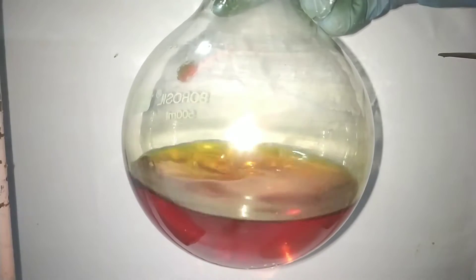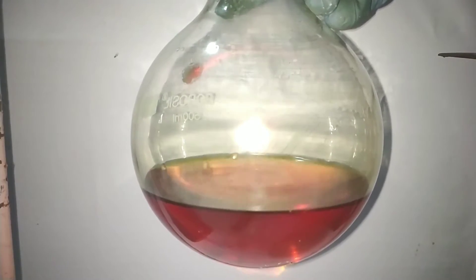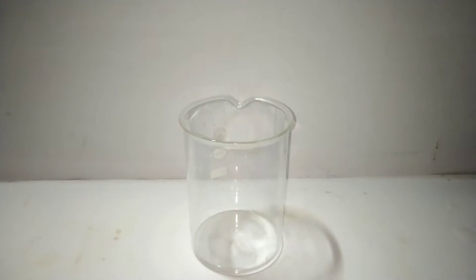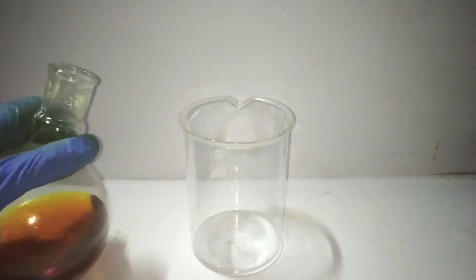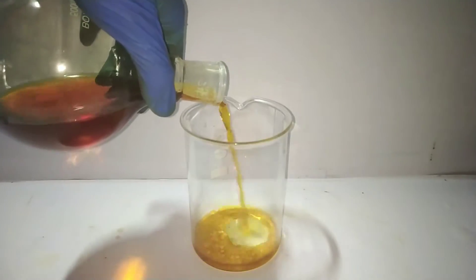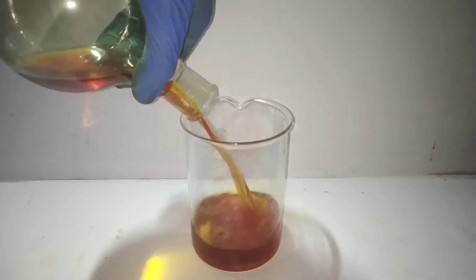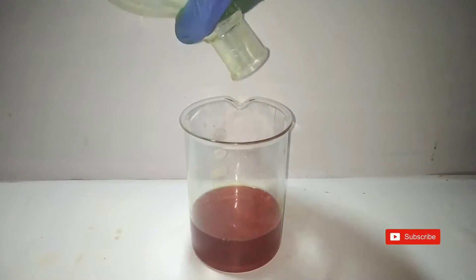The next step is to precipitate out the paranitroaniline. I decided to do that in a wide mouth container, as it will be difficult to remove the precipitate from a narrow mouth container after precipitation. So I poured everything from the round bottom flask into a 500 ml beaker.